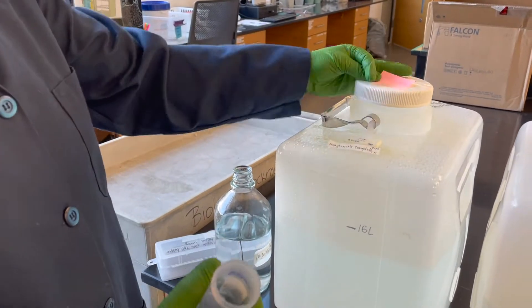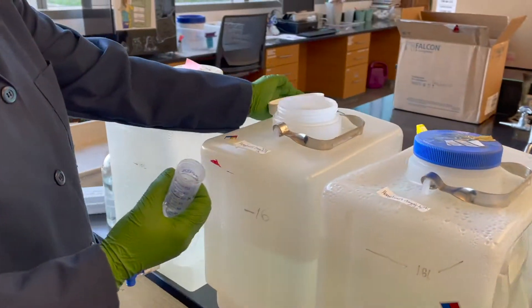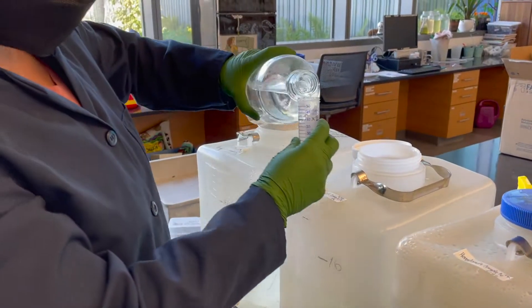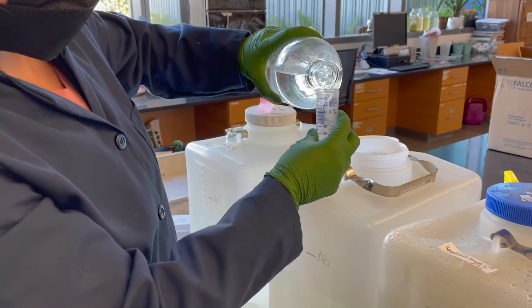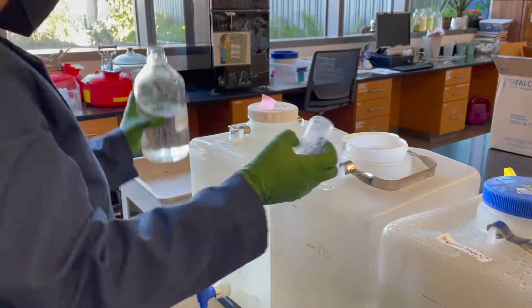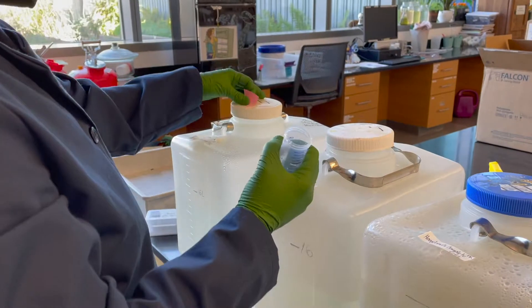Once I add a chemical into the first container, I mark it with a post-it so I remember where I finished in case I get distracted. I'll move the post-it as soon as the chemical is added.